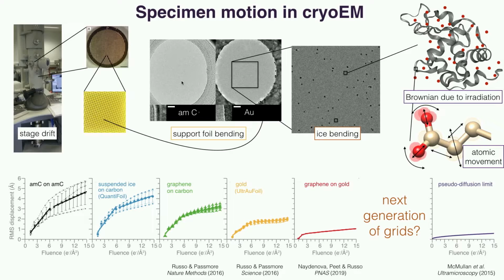vitrified sample within one hole like this, we would see that the particles within the ice are moving relative to the hole, which is not moving anymore. And we attribute this collective, somewhat correlated motion of the particles within the ice to a deformation of the slab of ice as a whole.